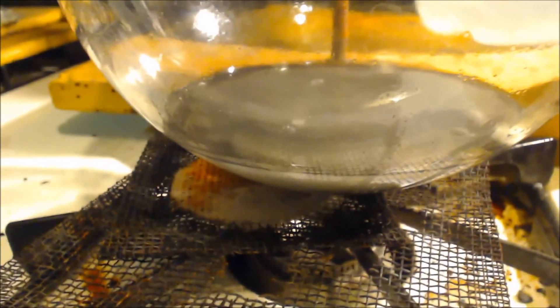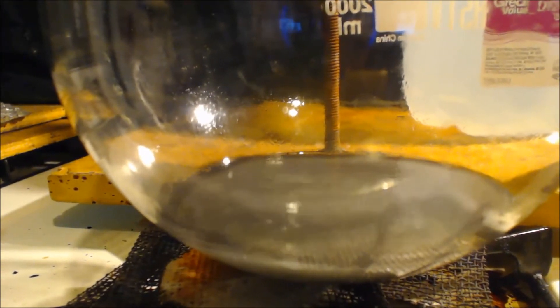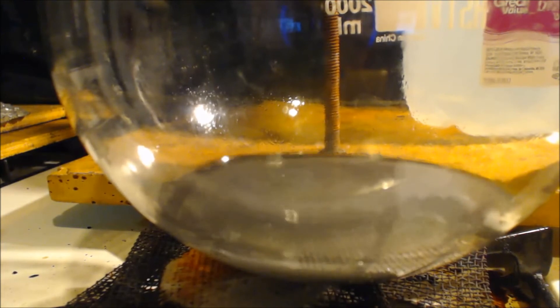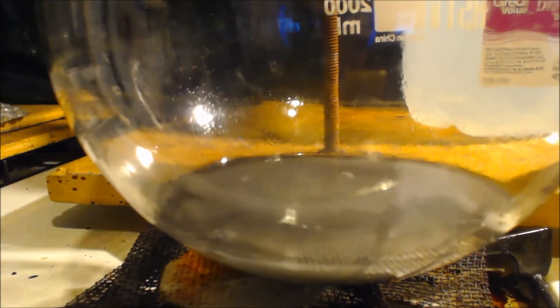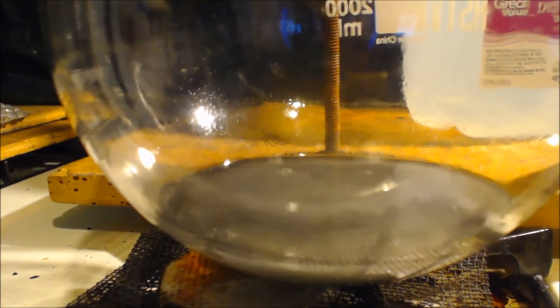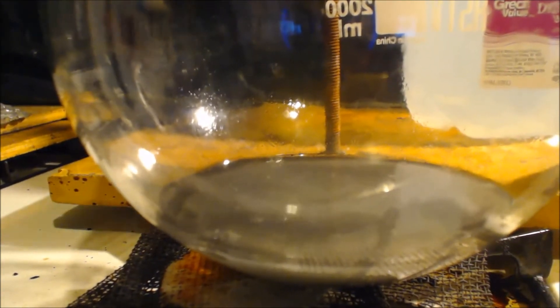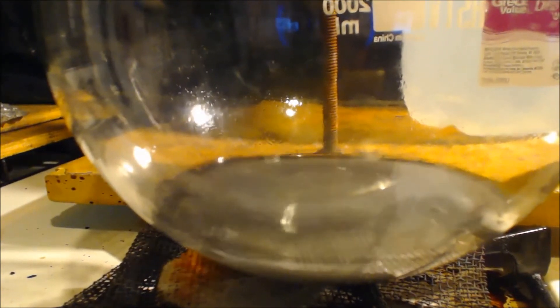Well, I still have a lot of water. See there? Well, it's also sulfuric acid. But it's still, it's not green at all. I mean, I do smell a little bit of SO2. But from this reaction, barely any. You know, just every once in a while, I've got to put my nose all the way up to the hole on the top of the glass apparatus and really take a sniff.